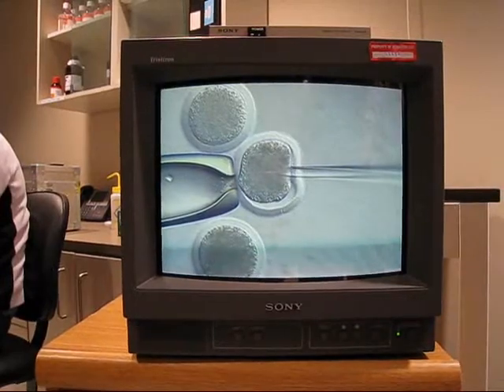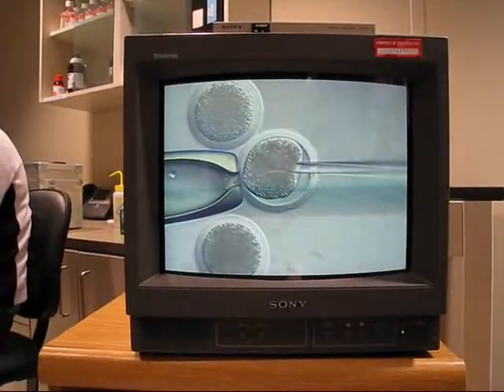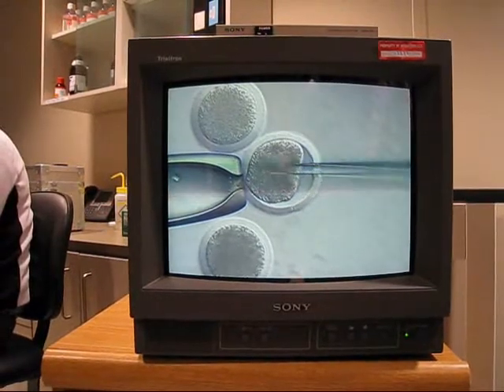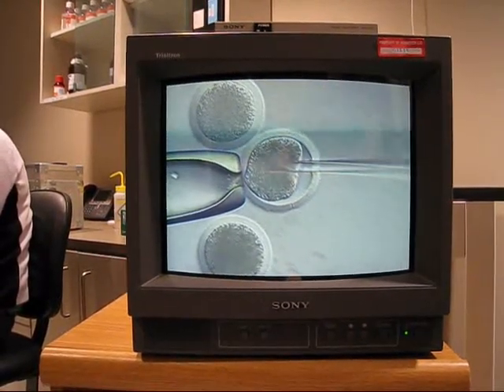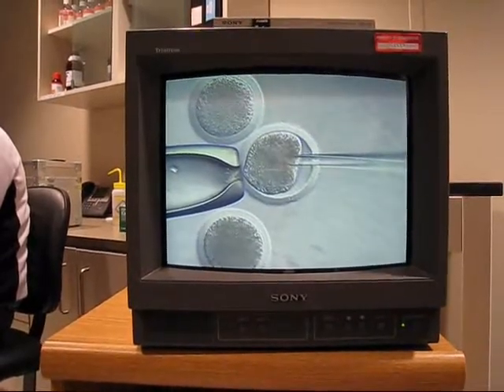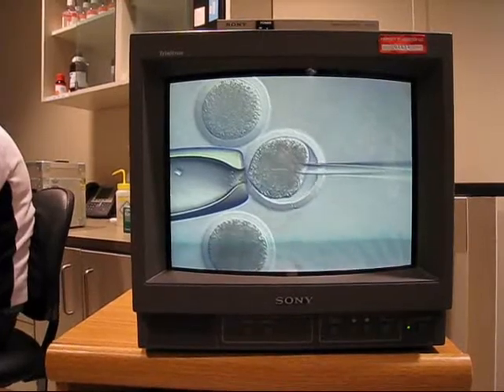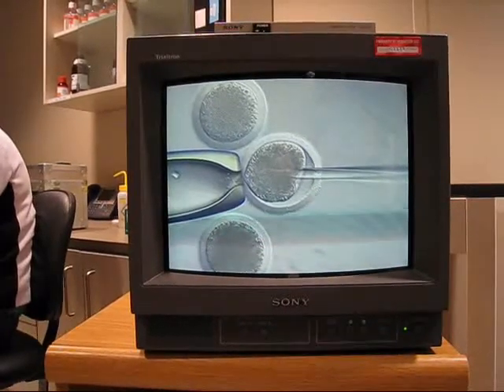What? Yeah. Awesome. Can I just try to suck one of them out? Yeah, it's right there. For the TV. Yeah. Oh, I see it, I guess. Is it counterclockwise or clockwise? Counterclockwise. You might want to shut the flash on, I'm thinking.